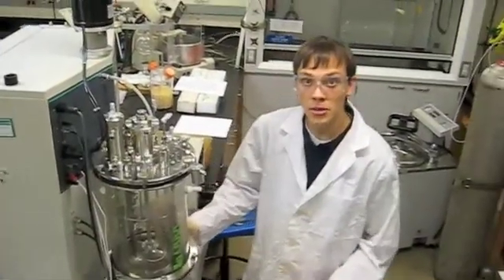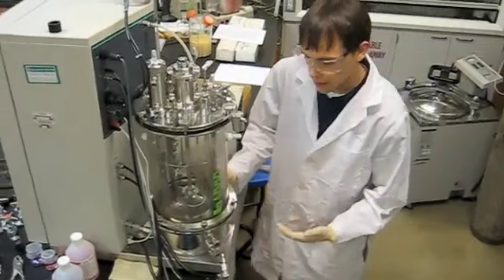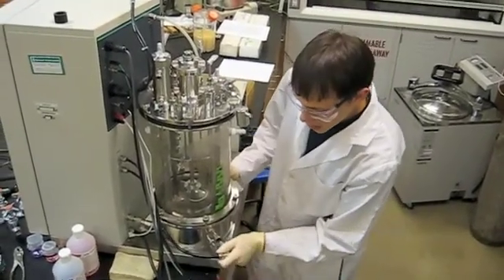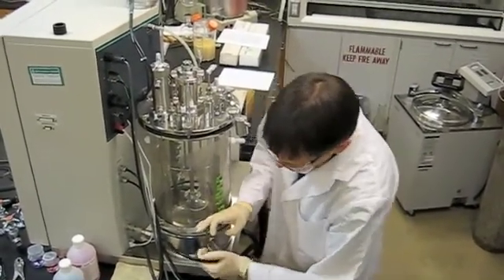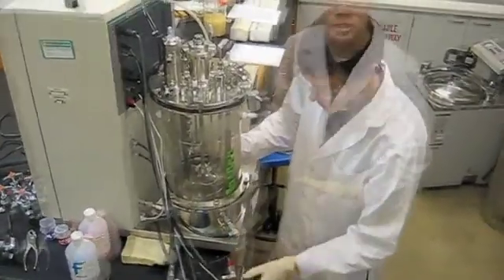Okay, so we're going to start by hooking up the vessel, and we're going to start with our water in and water out for the water jacket. You just place the connectors right here, and you push in until you hear it pop.